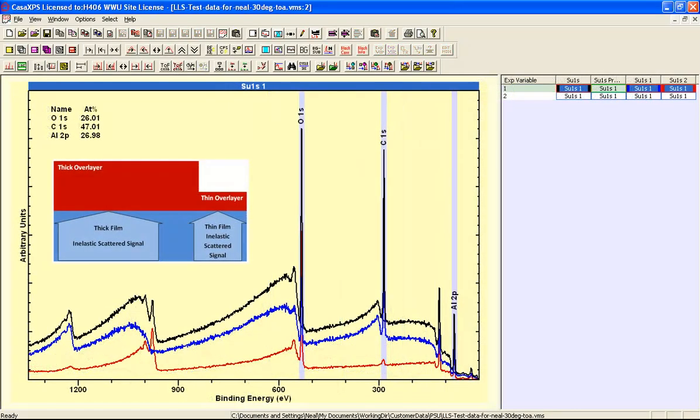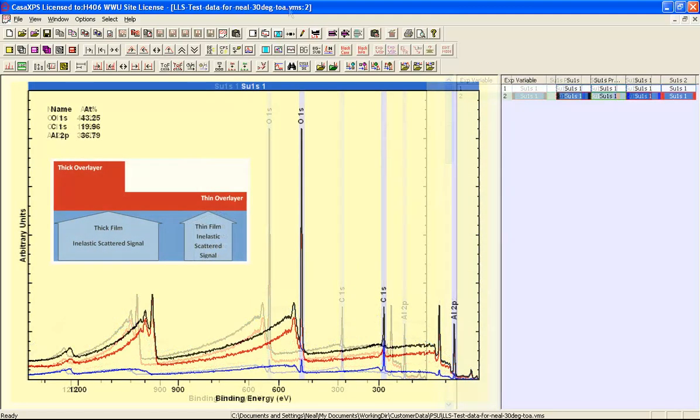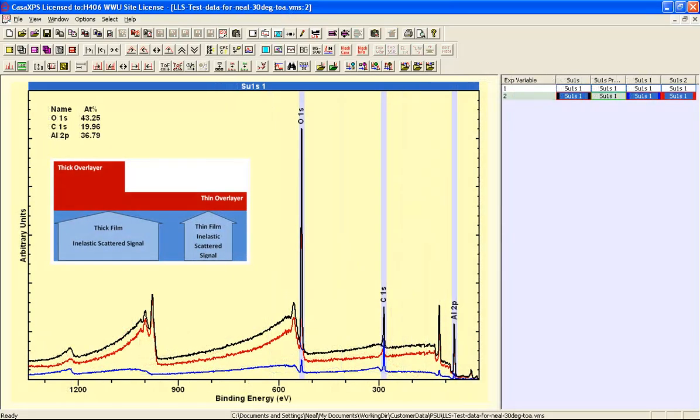So by separating the spectra using the difference method into component spectra, we can then interpret these original spectra and see how to interpret the shapes that arise in the background to each of these spectra.